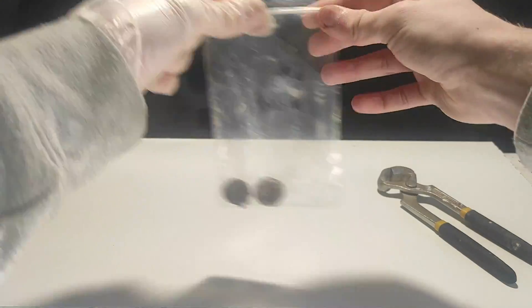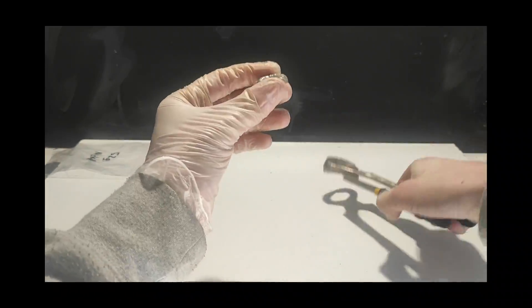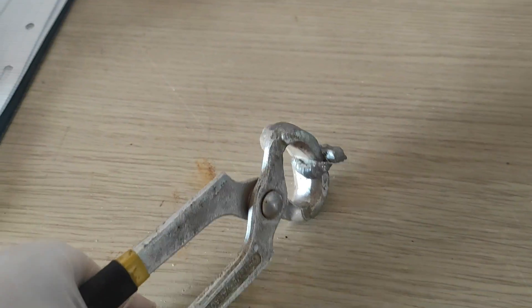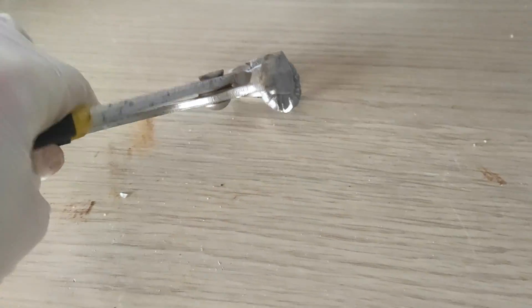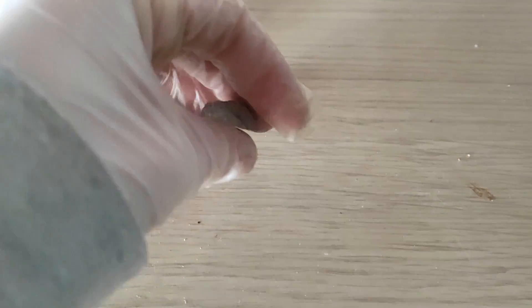For this preparation I would prefer to use less. I first tried cutting one with pliers but it didn't work. Then I tried to make it flat with a hammer but nickel is exceptionally hard. Finally I decided to use the saw and this worked pretty well!